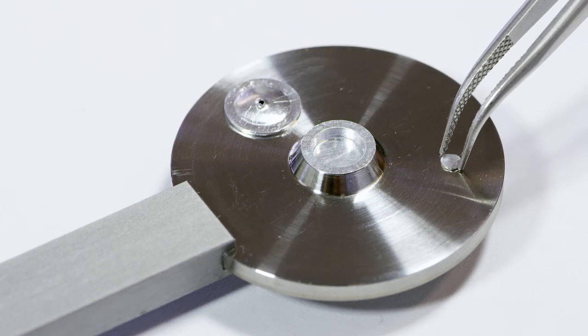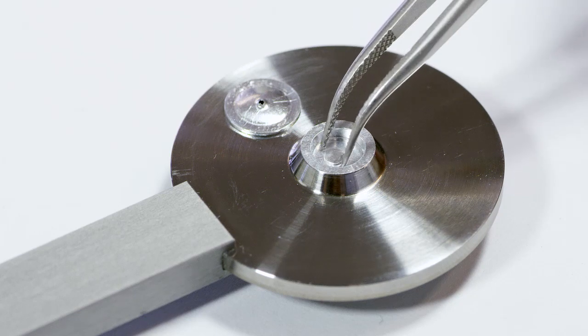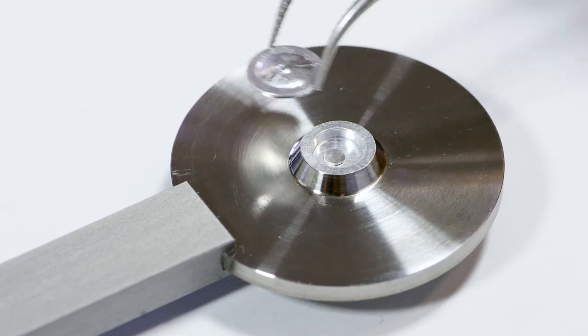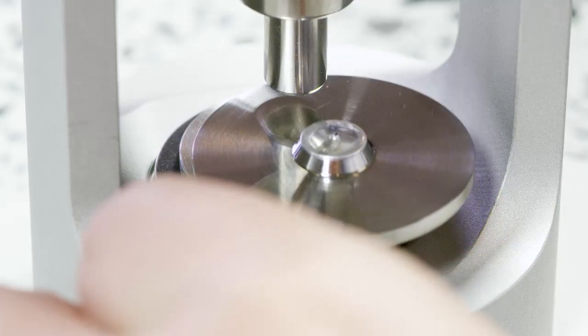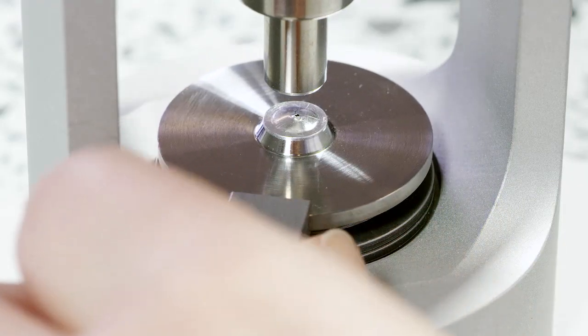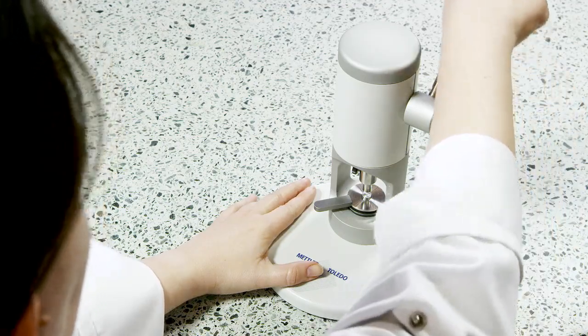Place the flat indium sample in the crucible. Close the crucible using the crucible press. Place the crucible on the die of the press, apply the crucible lid.